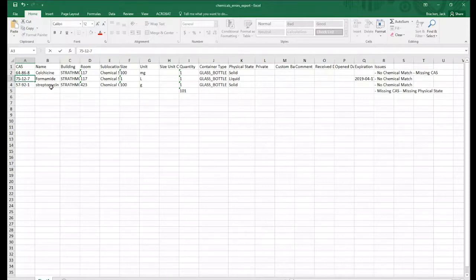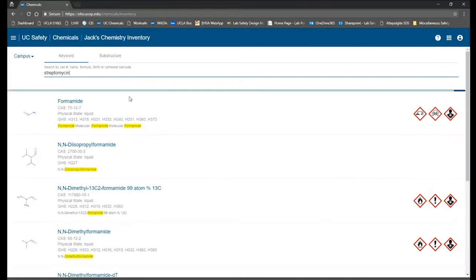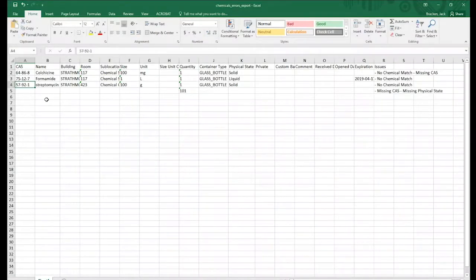Lastly, we have streptomycin. Go back to UC Chemicals. I'm going to search streptomycin the same way I searched formamide. And it turns out streptomycin sulfate shows up. Well, I went ahead and looked at my chemical bottle and saw that it was actually streptomycin sulfate, and the CAS number shown here is the correct one. So go back to my spreadsheet, type in the correct CAS number, and that should do it.